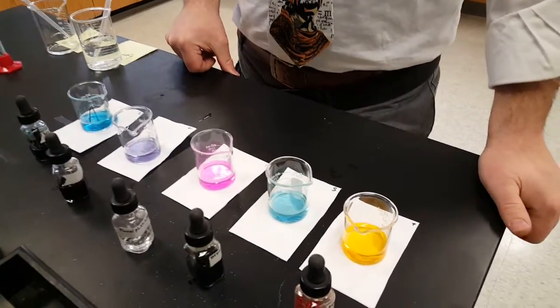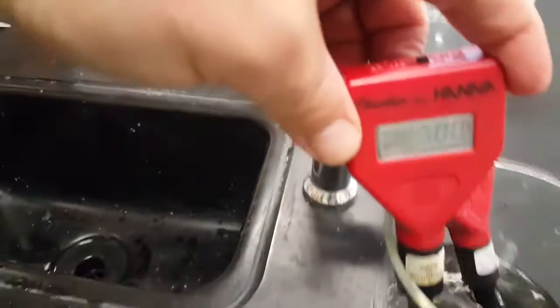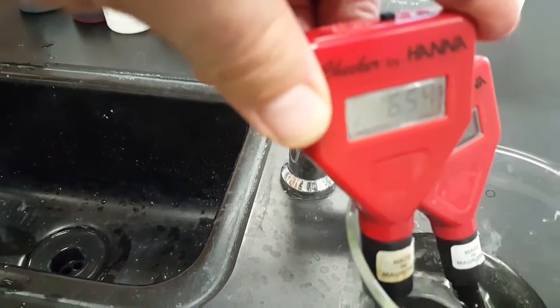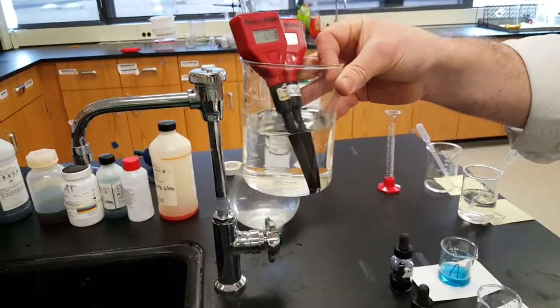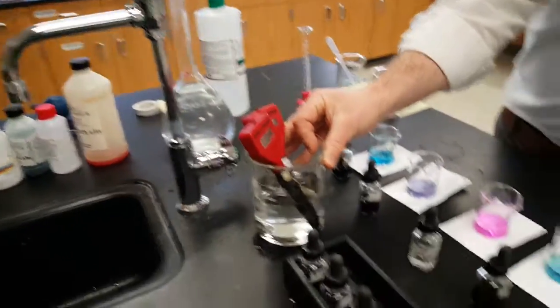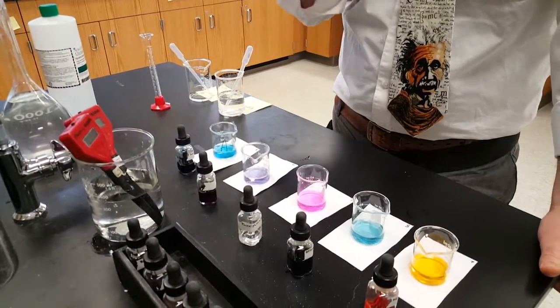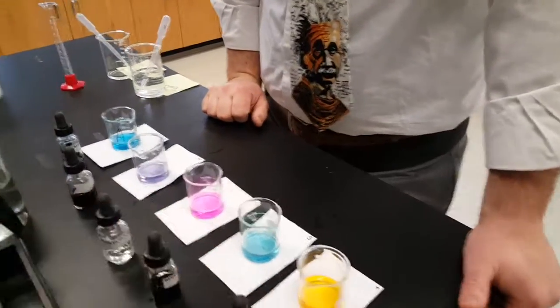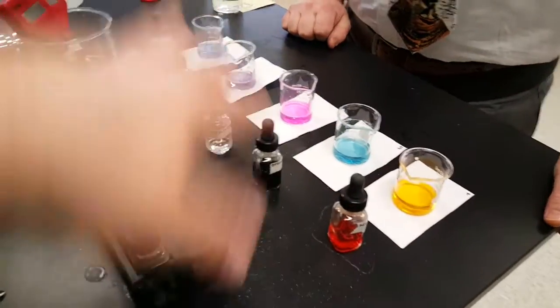But right, here's the key. If I'm going to go ahead and pH this guy, you've got to clean it off in between. You've got to rinse it well. And you want to see this go back to almost around about 7, the number it was at. If it was 6.6, you wanted to go back to 6.6. And then replace that with fresh water when you're done. Please. And you'll turn it off. They're okay to sit in there because I mentioned they have to remain wet in order to function properly. And I'm sure we're going to have a nice big waste beaker for these guys. You put them all in the waste beaker together, rinse out your glassware, and put the glassware back.